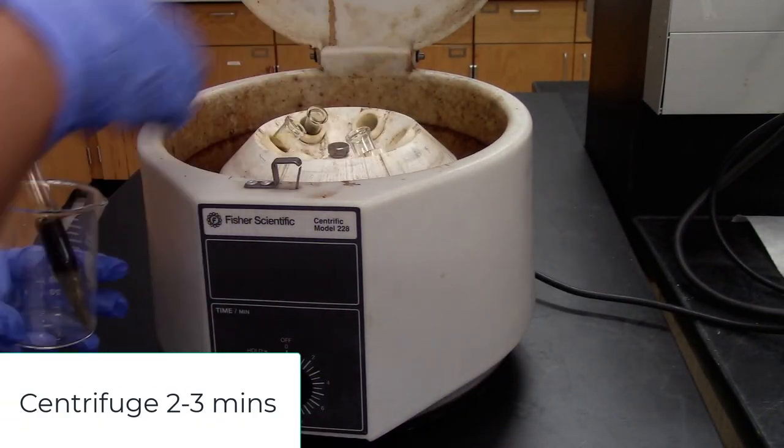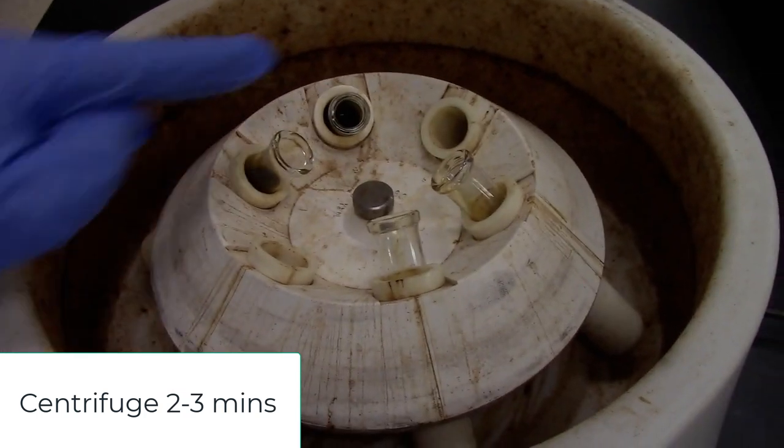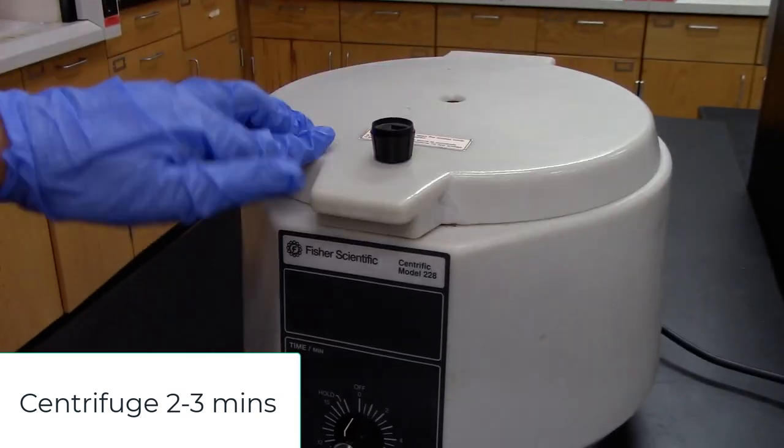Put the test tubes in the centrifuge so it's balanced and centrifuge for about 2 to 3 minutes.